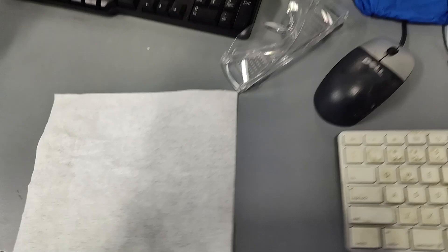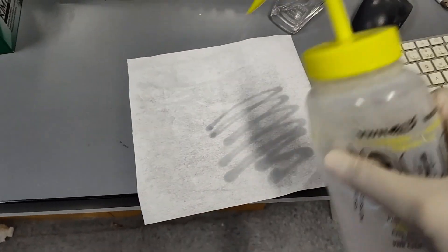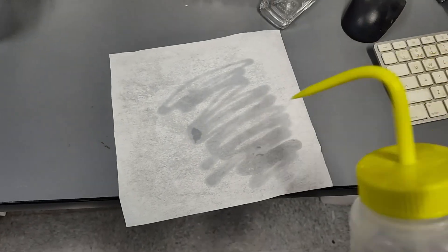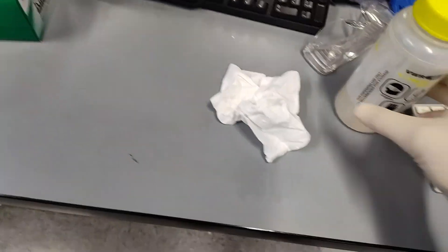These are really clean wipes. I'm going to use these. We'll do one with just isopropanol as a control, and the other one will be sprayed with isopropanol and wiped to clean off the keyboard, and we'll extract them both in the analyzer. I'm going to fake-squirt isopropanol onto our control and get it on my gloves. That's a good control.